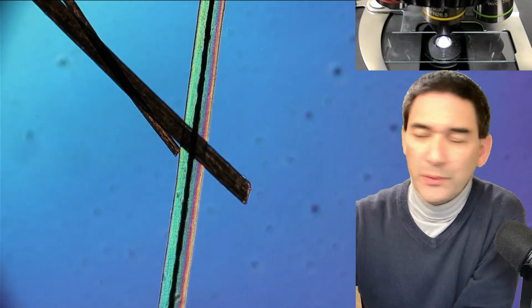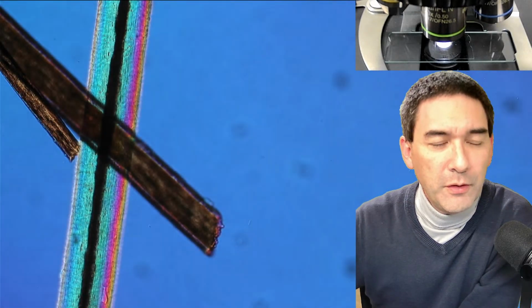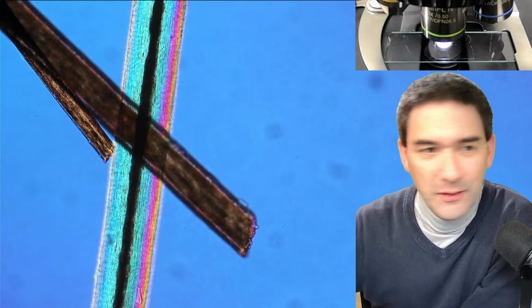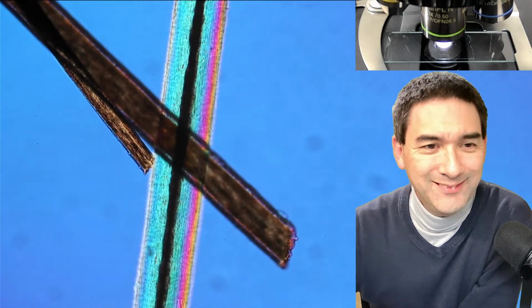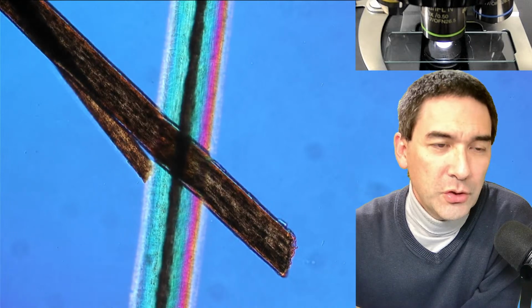That's exactly the place I wanted to show you. This is a pretty coincidence. This is basically both of my hair. Yeah, and what do you notice? You notice that I'm already becoming old because this is actually one of my hair that actually turned gray.